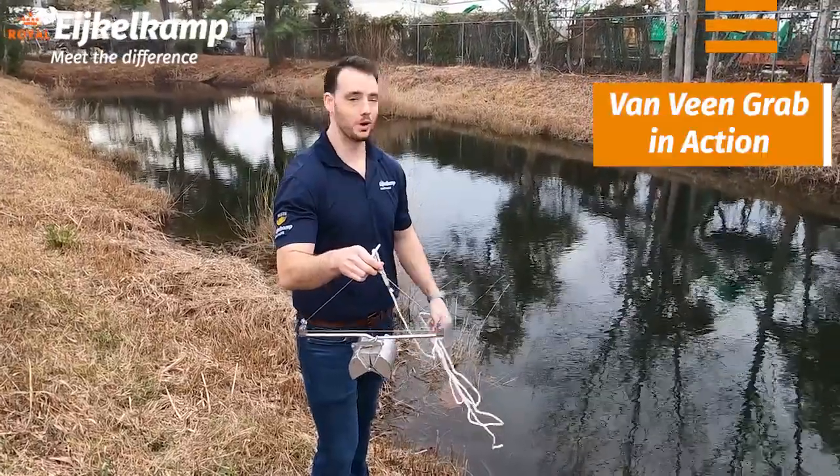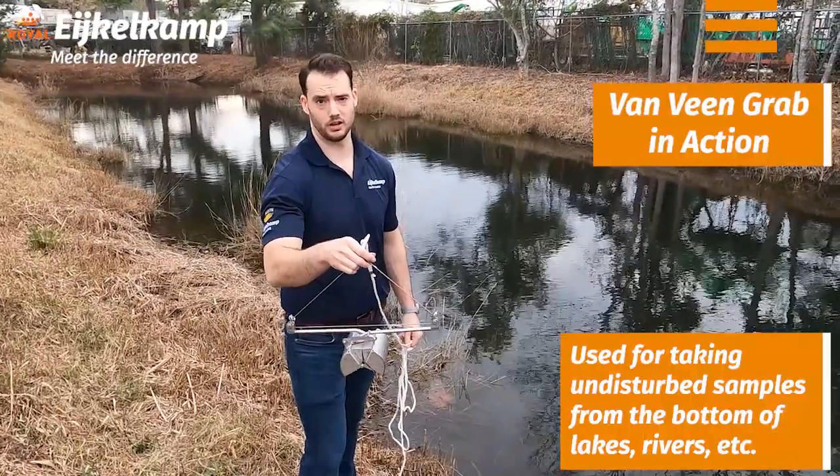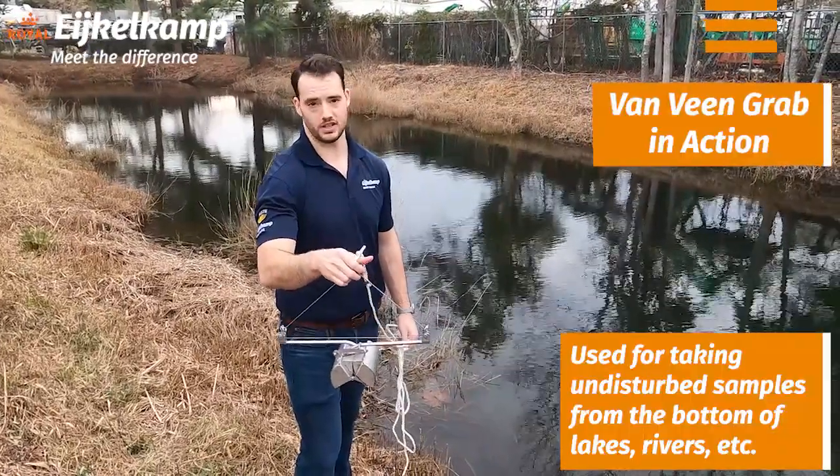It's sunny out at 75 and they mowed so I can actually get to it. We're going to show what this can do with that sediment when we're trying to capture those unconsolidated samples.